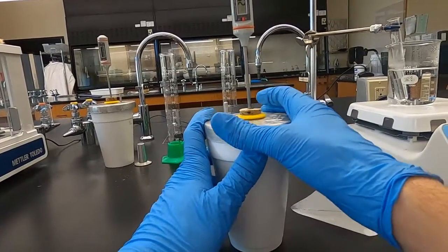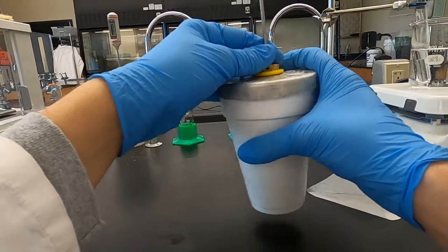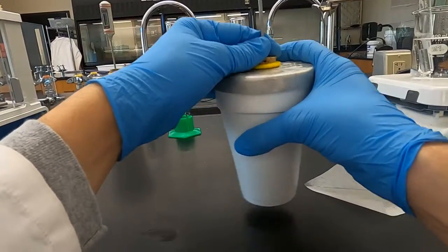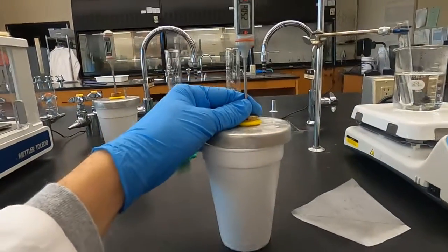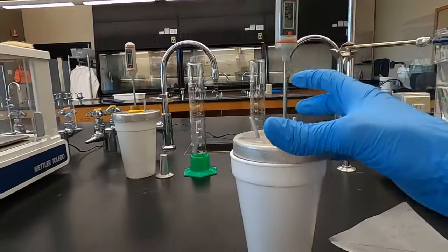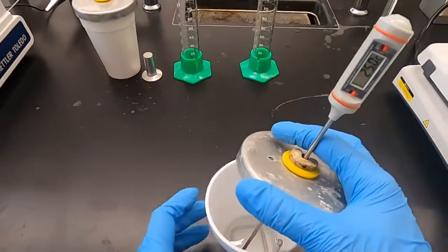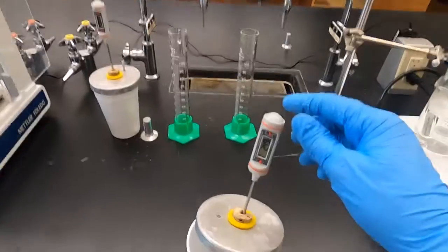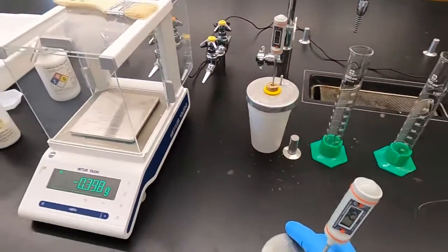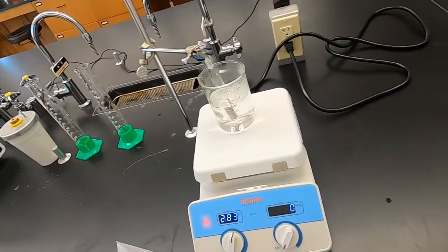Check the solids, make sure that they're all dissolved. If it changes, then we know. If it decreases, we know the 25 was still good. One last good shake before I check. But 25.0 degrees Celsius. Looking inside, no solids. We're doing good. 25 it is, our final temperature. Take that, subtract it from our initial, and we have our change. That'll help you with your questions at the end.